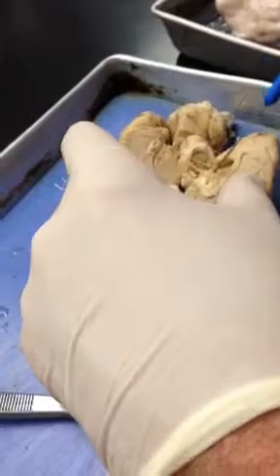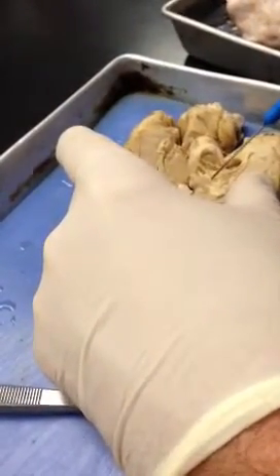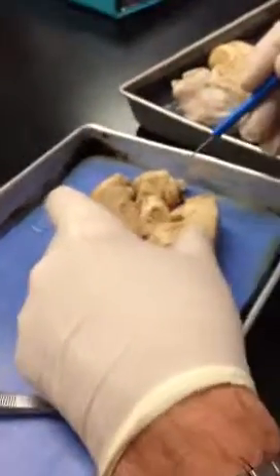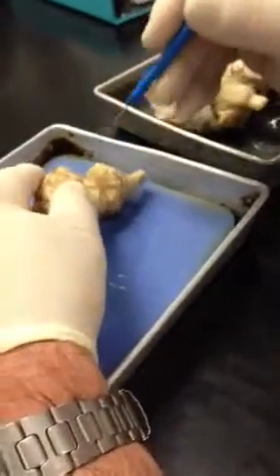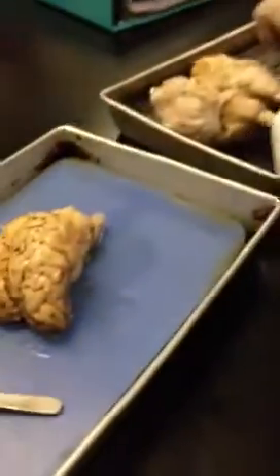The pineal gland, oh, there you can see it. It didn't get cut very well, but this little thing I'm popping up right there is the pineal gland. And just a couple of other features: the corpora quadrigemina, the superior and inferior colliculus. And let's see, what are we going to use? We'll use this one.